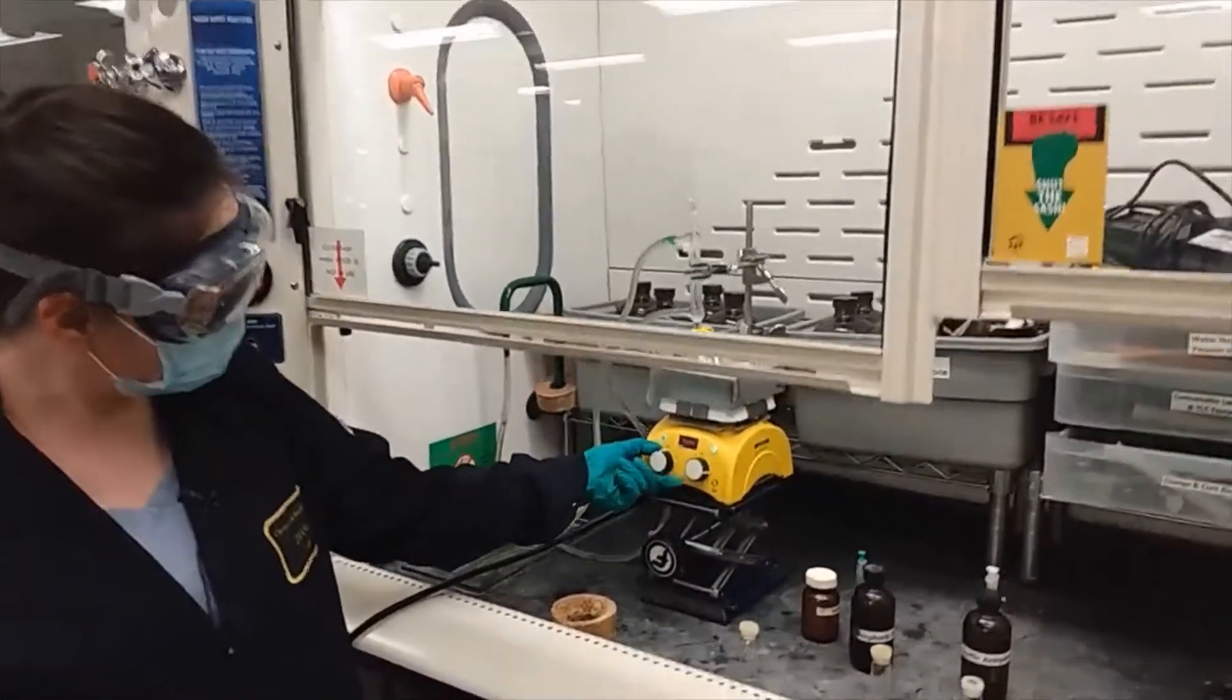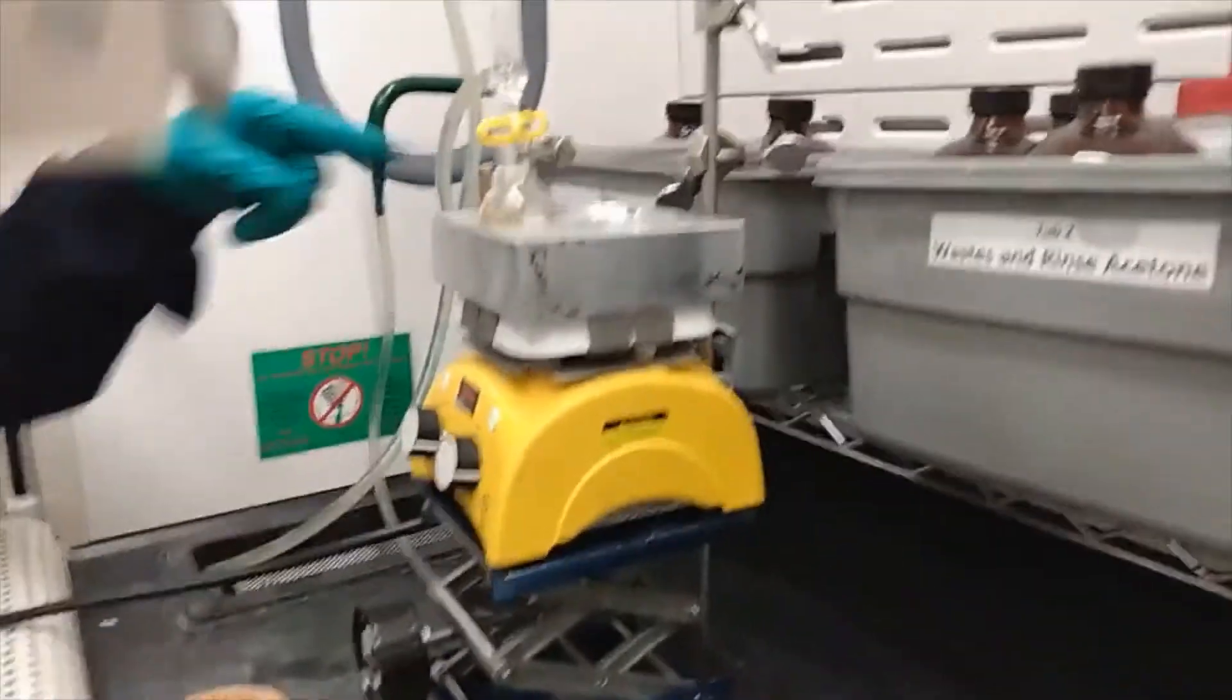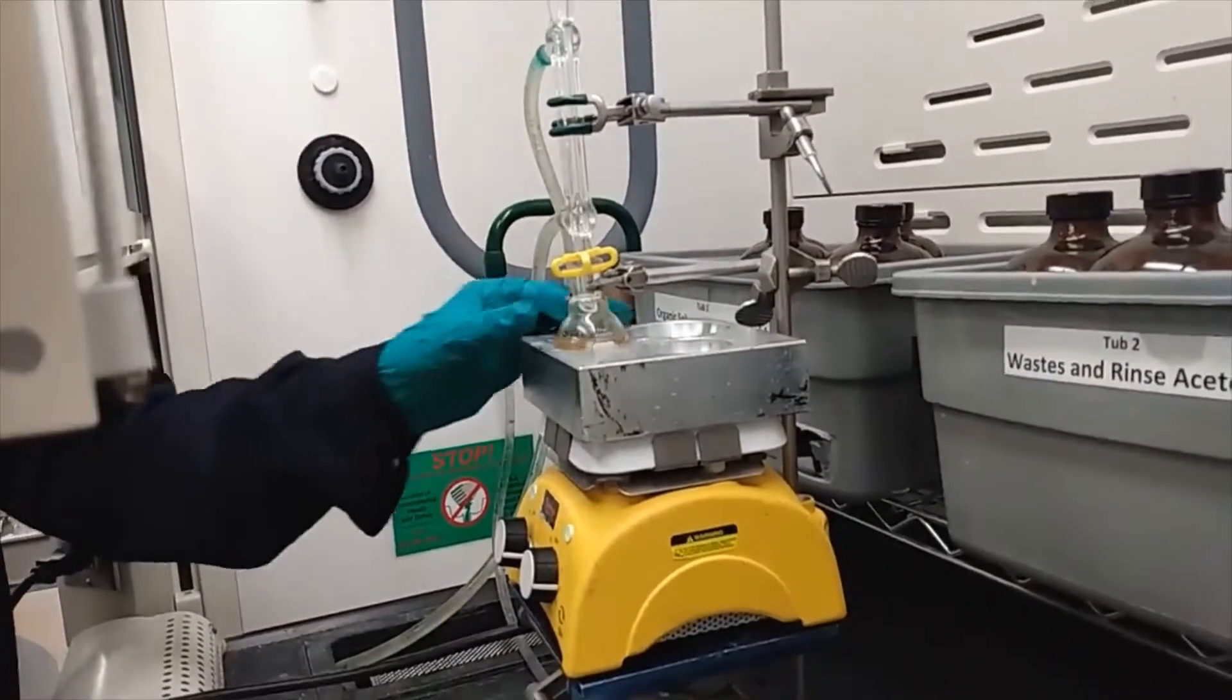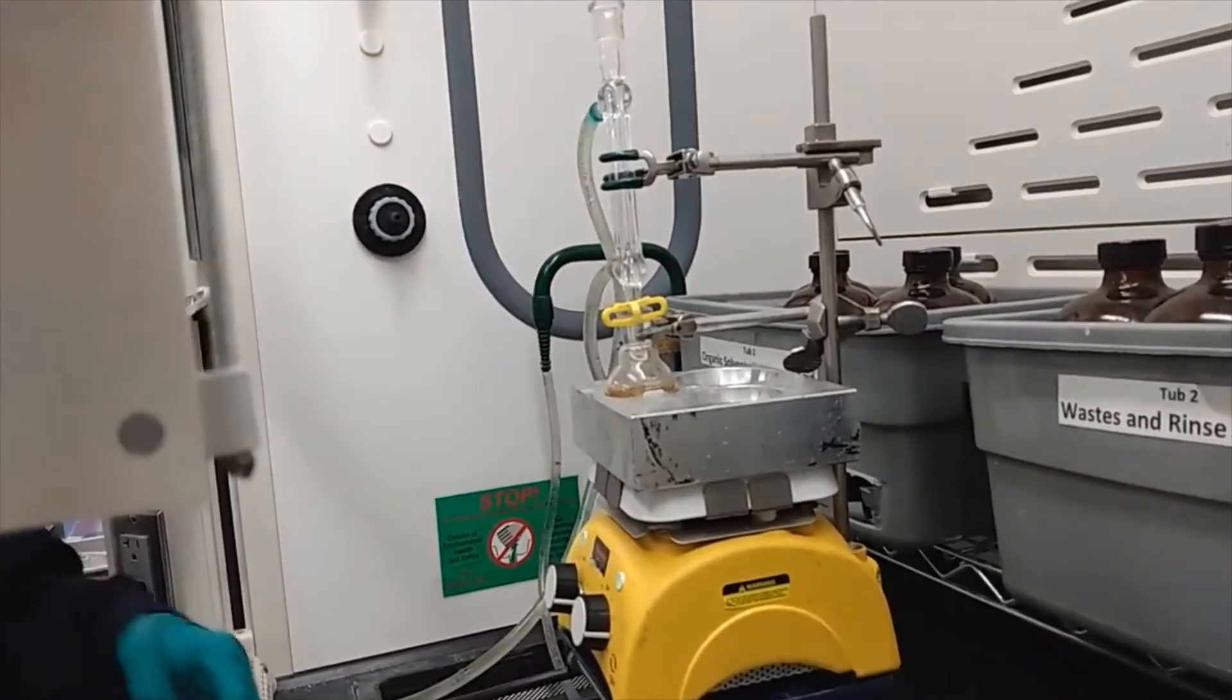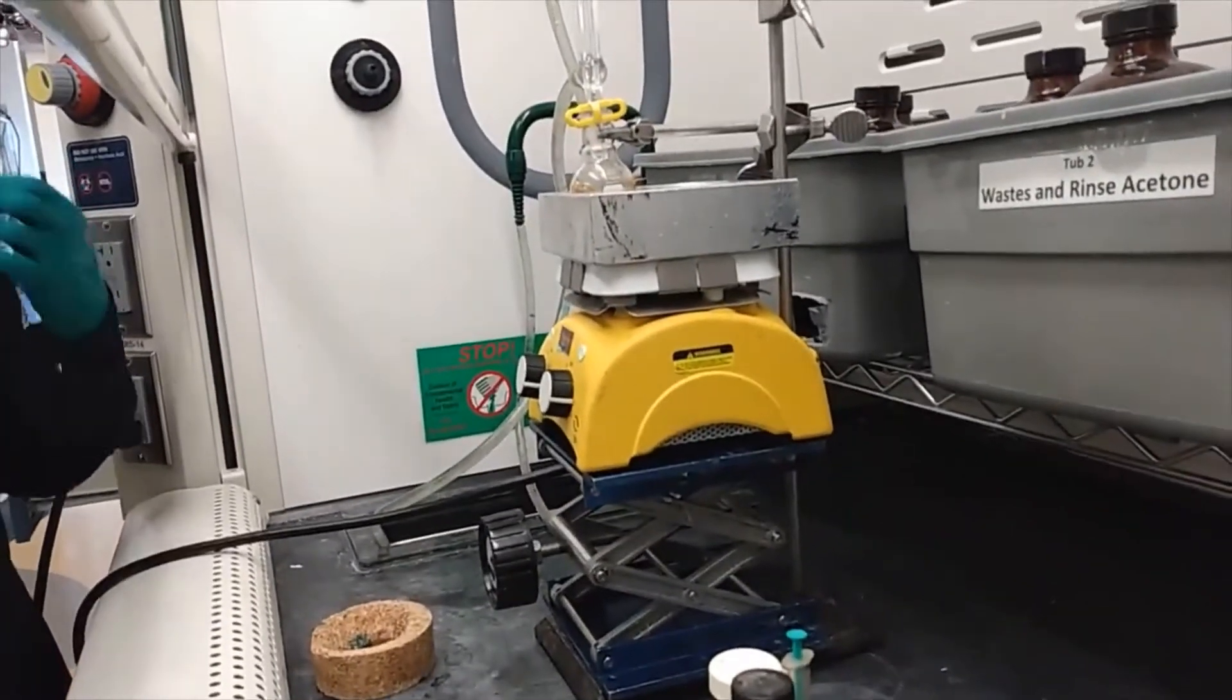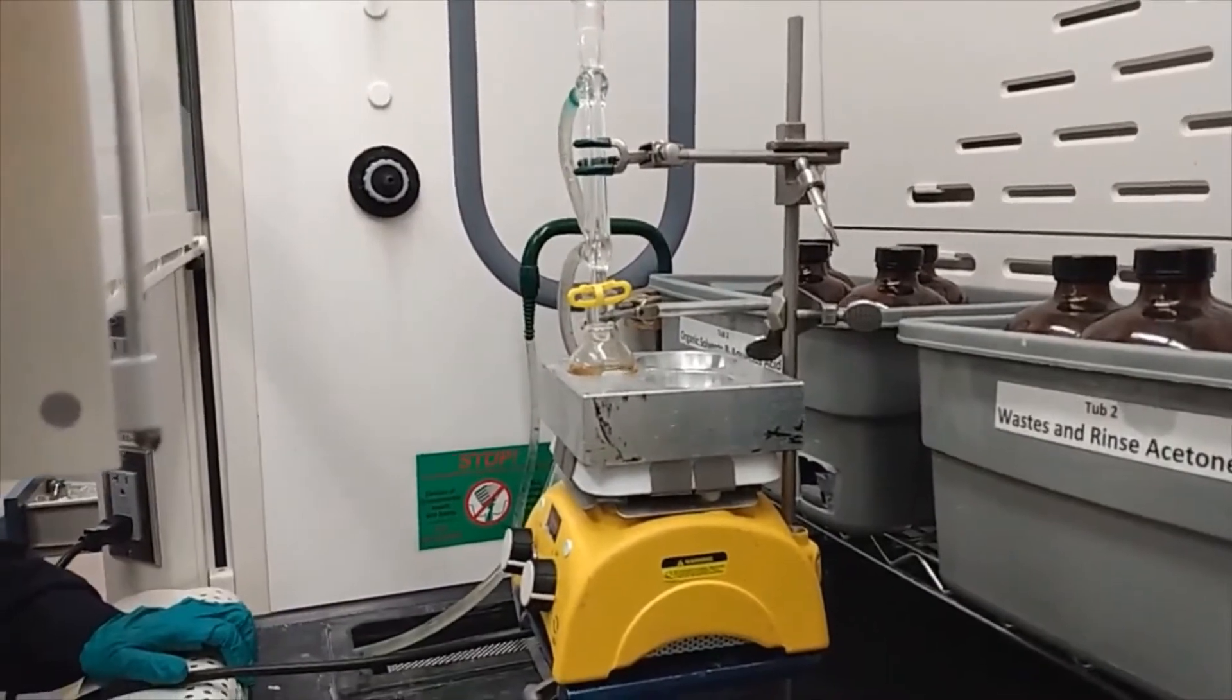We're going to set the temperature to 34°C, stirring it vigorously so we get a homogeneous mixture. We have a reflux set up with water running, using clamps to hold it together so that it doesn't fall, and also having the hot plate elevated so that if there's an instance where it gets too vigorous, we can lower it.